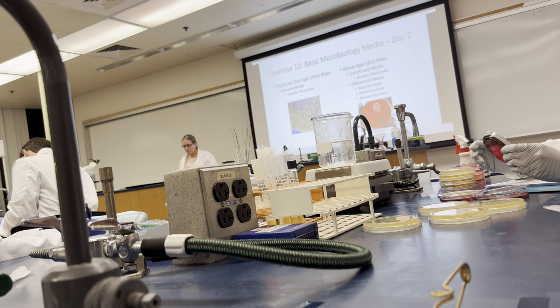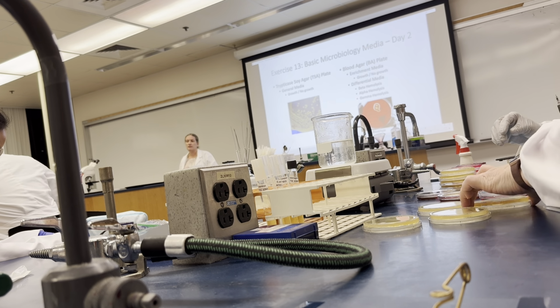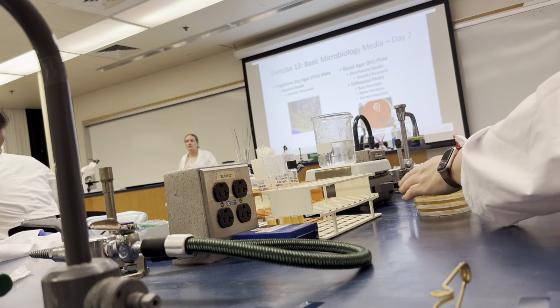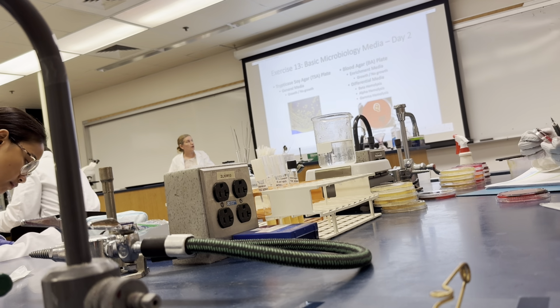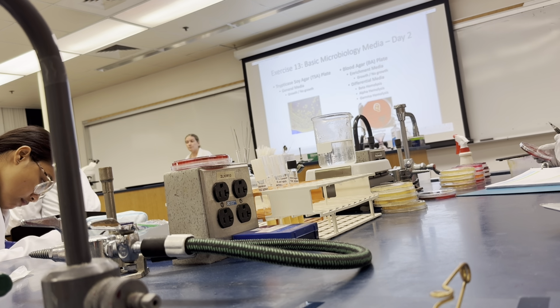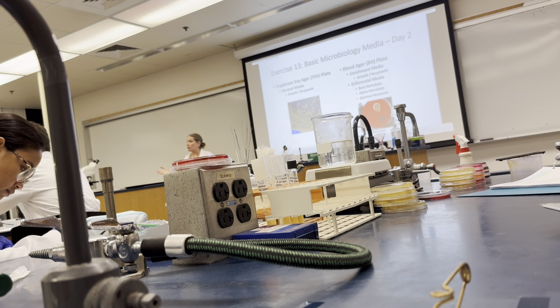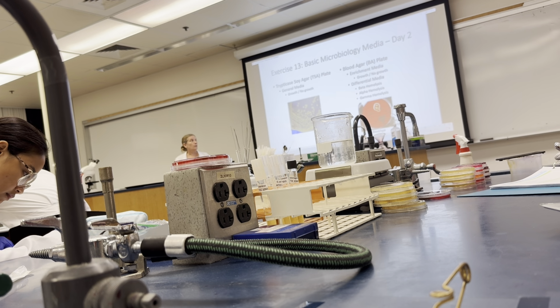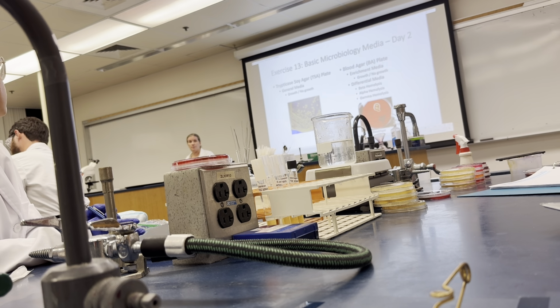All right. The next plates you're going to look at, so you put TSA off to the side, we're done with it. The next set of plates are going to be the blood agar plates. So the blood agar plate is an enrichment media as well as a differential media. So you have two bits of information. One, does it grow or not grow? And then the second bit of information for the observation is, what type of hemolysis do you see?